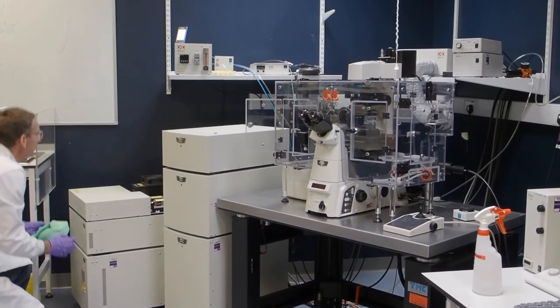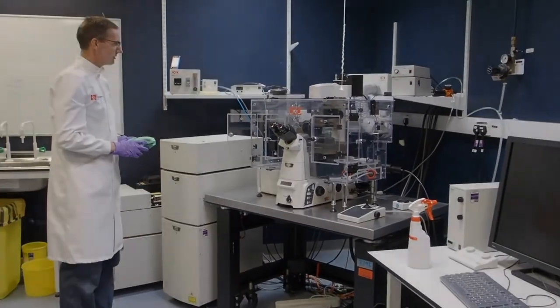Now you are ready to start up the system and use the microscope. Once you have finished and switched off the system, repeat the cleaning process.